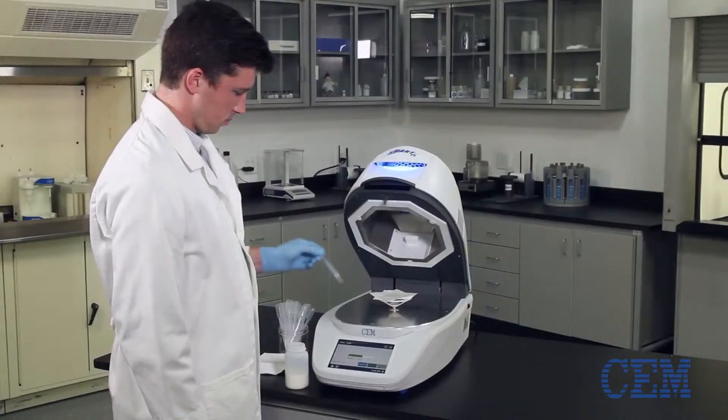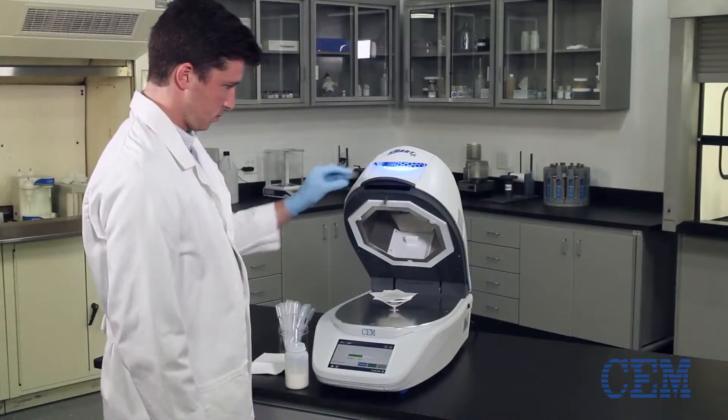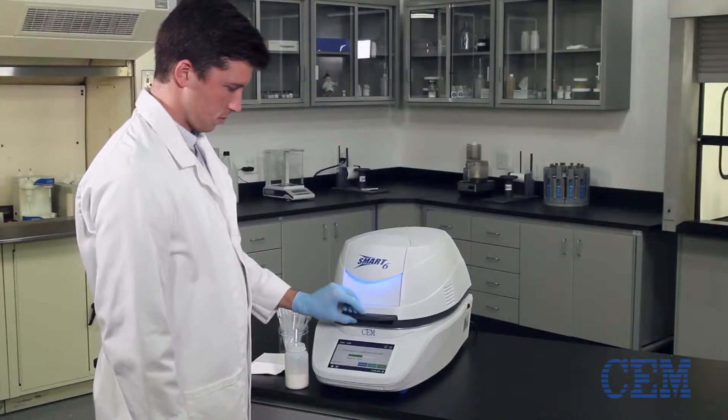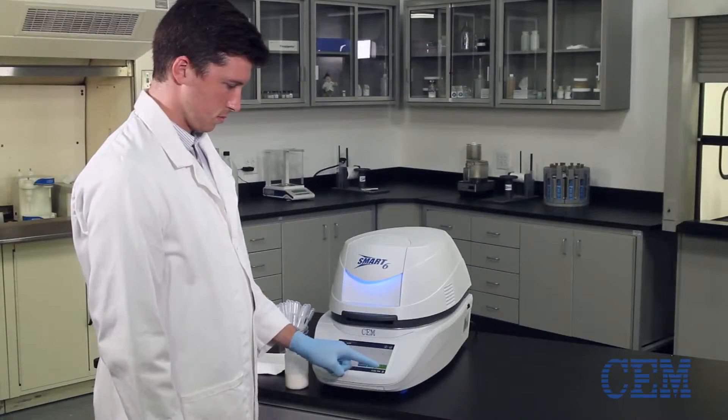Once your sample has been properly applied, place the sample and pads back on the balance, close the lid and press Start.